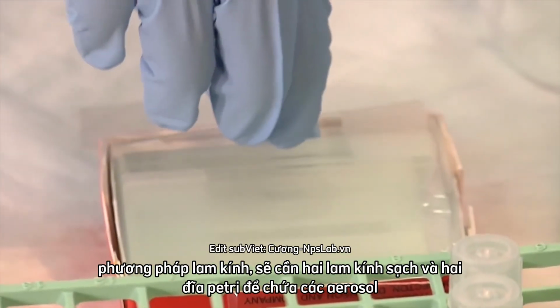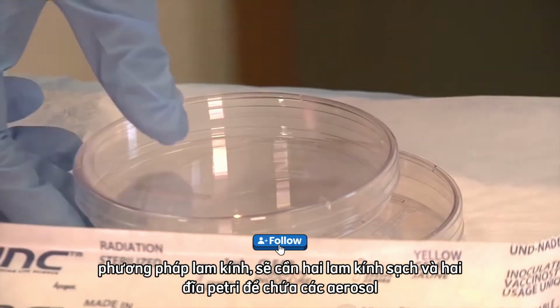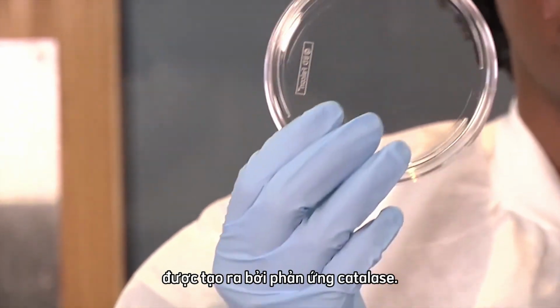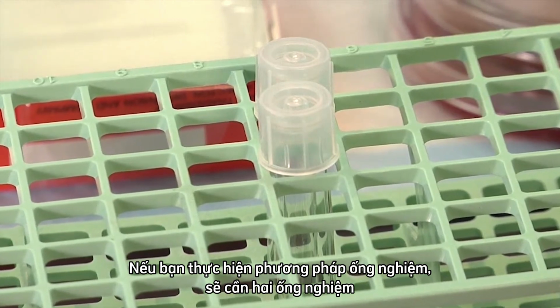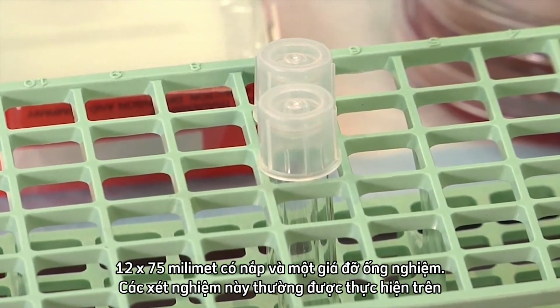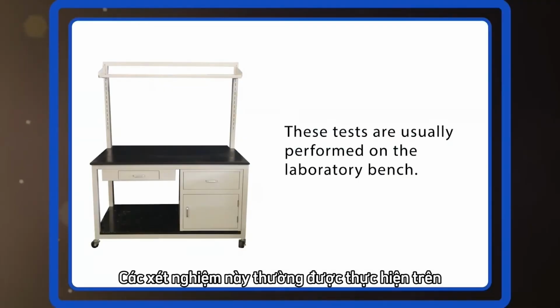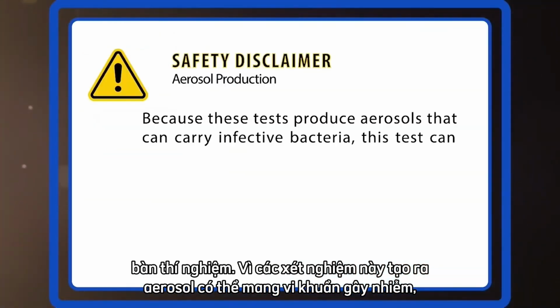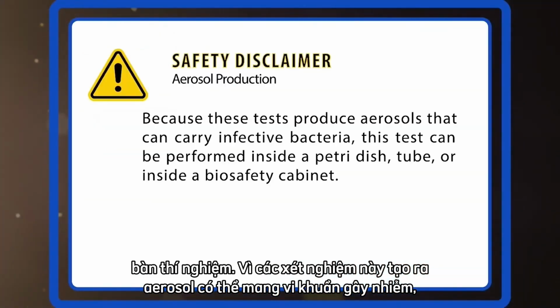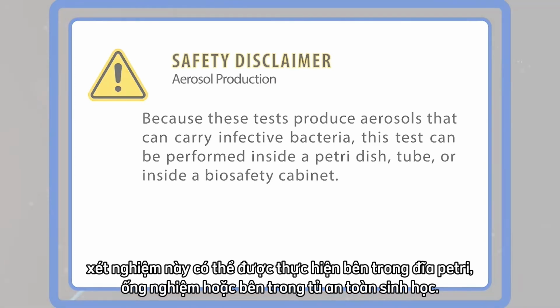If you're performing the slide method, 2 clean glass slides and 2 petri dishes will be needed to contain aerosols produced by the catalase reaction. If you are performing the tube method, 2 12 by 75 millimeter test tubes with caps and a test tube rack will be needed. These tests are usually performed on the laboratory bench. Because these tests produce aerosols that can carry infective bacteria, this test can be performed inside a petri dish, tube, or inside a biosafety cabinet.